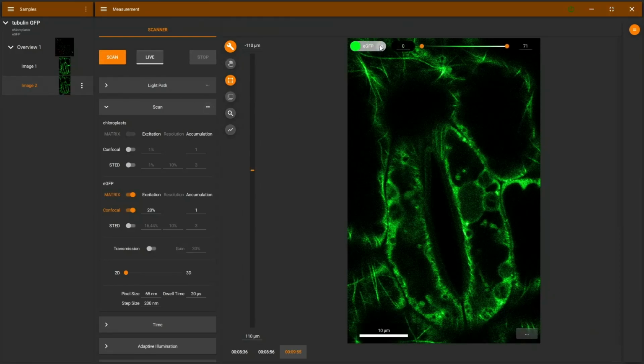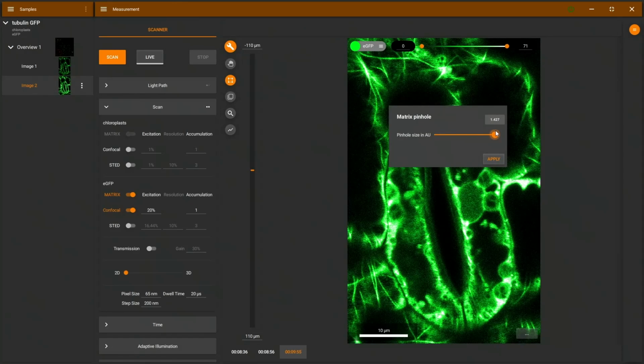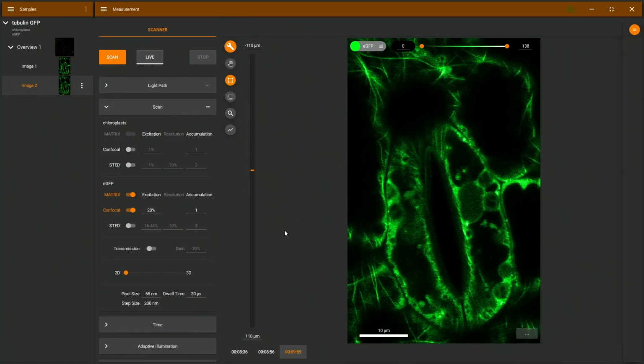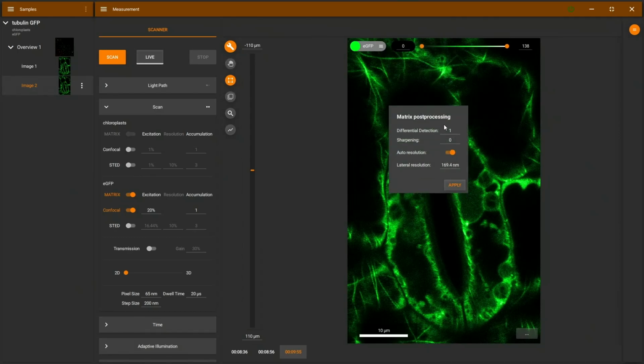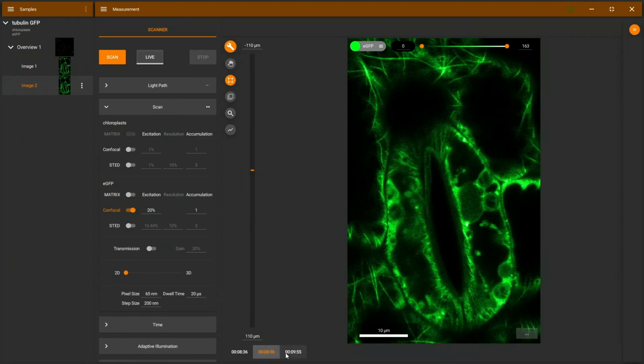What is this? This is a virtual pinhole image. So basically, we're calculating from all the detectors here an image as if we're using a pinhole of different sizes. And this is done immediately while we're recording, and you can see it looks very similar to the normal confocal image. But we can do more with a matrix detector. So let's go to post-processing, differential detection. This is important. It's also calculated very quickly, but you can see the difference.